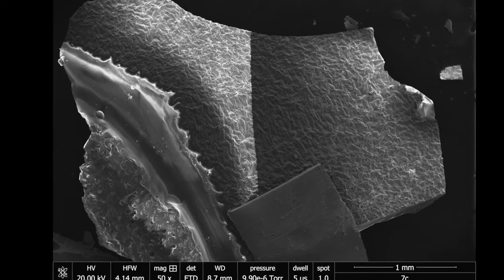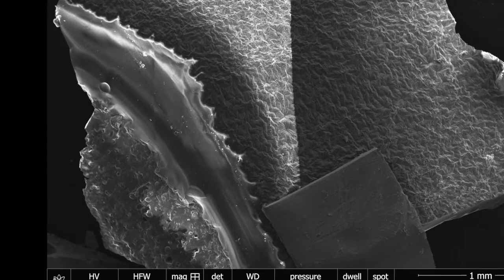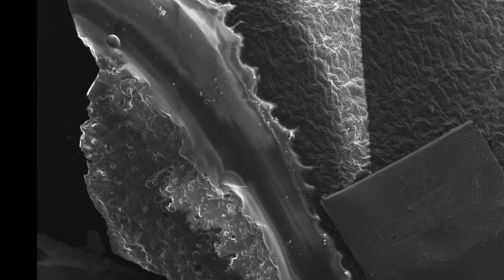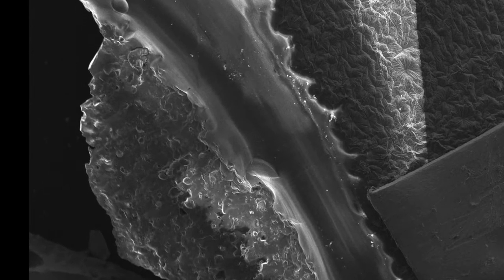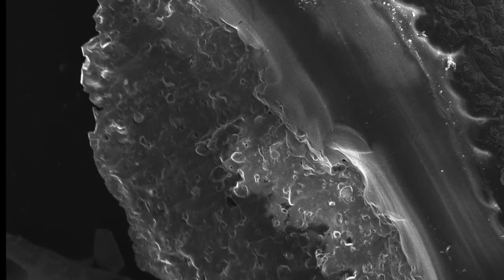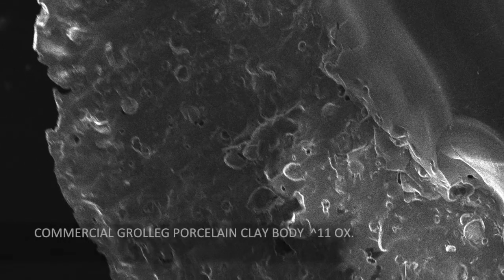And this image is really interesting because, like the stoneware oil spot, you can actually see the surface of the glaze, and then you can see the thickness of the glaze. And then on the bottom left, you can actually see the porcelain. Essentially the biggest difference is that porcelain is much higher in silica, and so you've got a much glassier clay body.